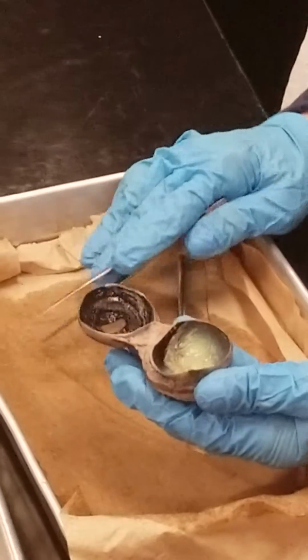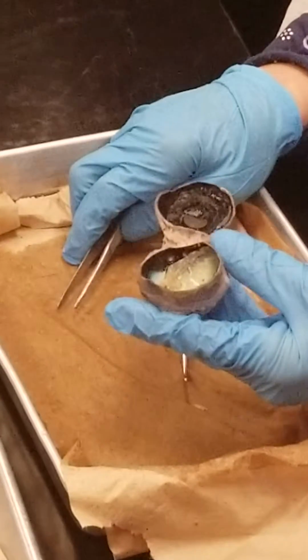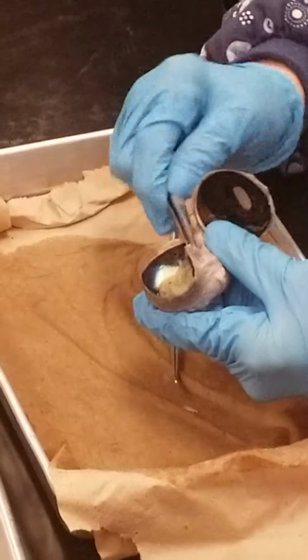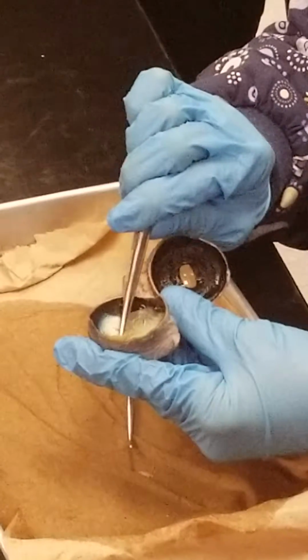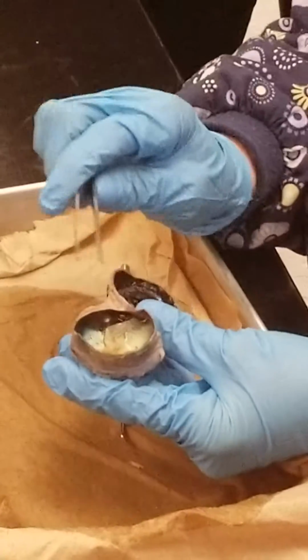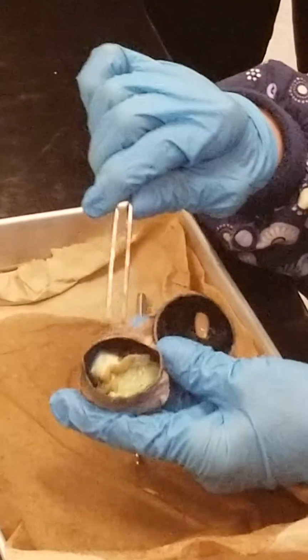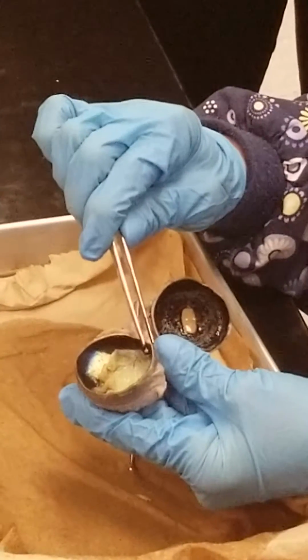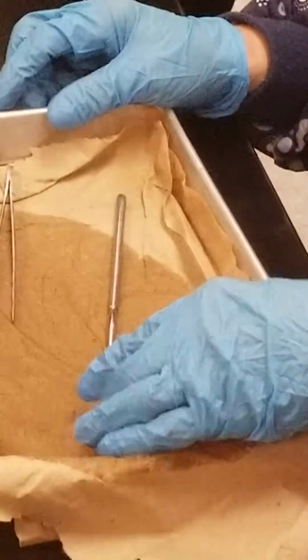As we move to the back, the posterior chamber of the eye, we're going to see 3 different layers. The most superficial layer of the posterior chamber is the sclera. That's what I'm pinching here, this tough fibrous part. That's what kind of makes the eye round there. The middle layer is this pretty blue-green stuff. This is the choroid layer here. And the deepest layer is this yellow, thin membrane. That's the retina. And I'm not going to pull it off because it'll tear. But the retina is the deepest layer, and then we see the choroid here and the sclera. So those are the structures that we need to know on the cow eye.